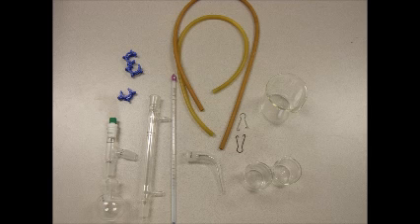As usual for any kind of experiment, it is first necessary to gather all the materials that will be needed to perform the process. It is also highly recommended that the materials are checked to ensure that they are of sufficient quality.